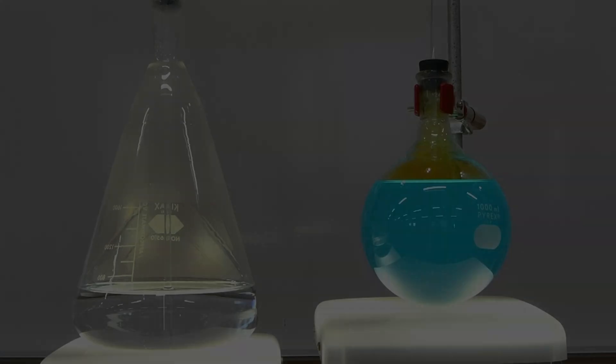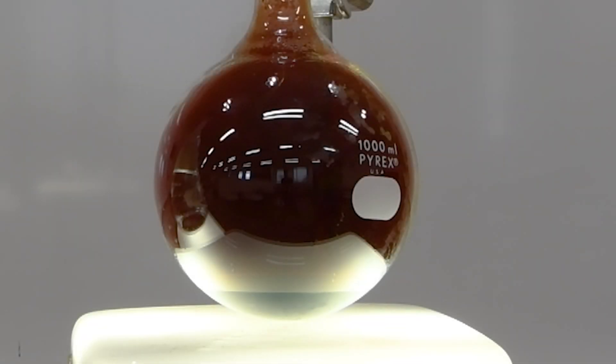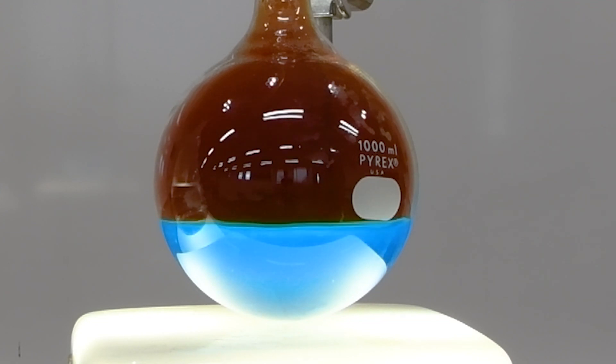Let's go ahead and take another look at this, but we'll zoom in on that flask. That'll give you a bit of a better view here. You can see how quickly the water is rushing in there when the nitrogen dioxide dissolves and forms a vacuum. It's a pretty exciting demonstration.